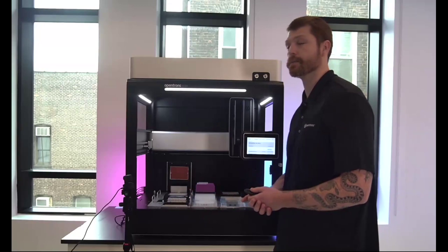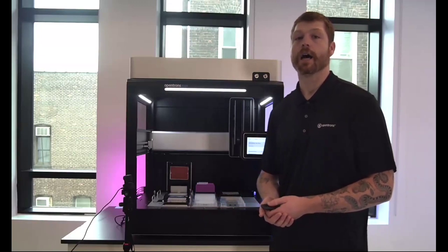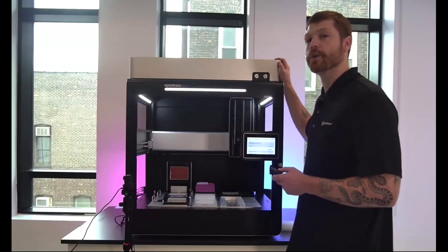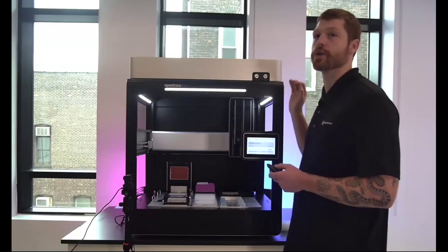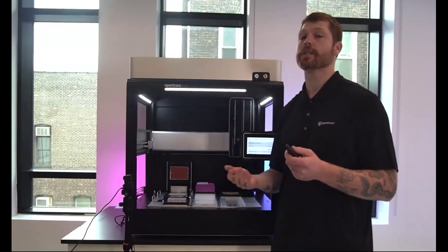The thermocycler module comes equipped with a 96 well PCR plate adapter that houses most normal PCR plates. And then up on the top of the instrument here as well, you can see the relatively new HEPA UV module. This will provide positive pressure into the instrument, as well as the ability to turn on UV sterilization. As I had mentioned previously, the Flex is totally modular.